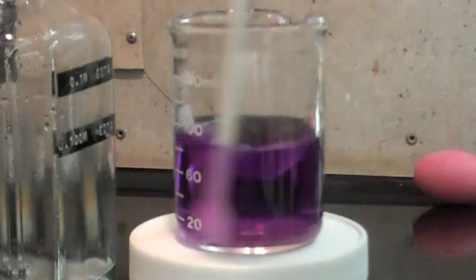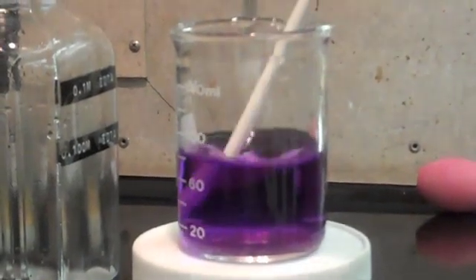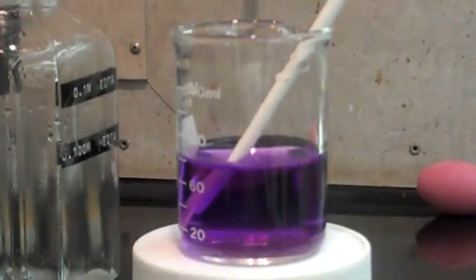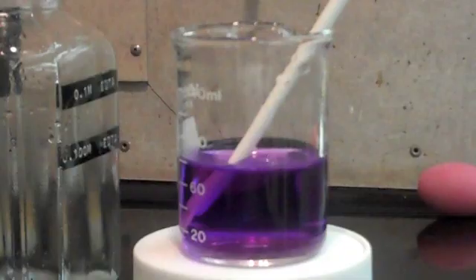You'll see that nice bright purple endpoint. This titration can be found in our technical data for all of our electroless nickel products. Thank you.